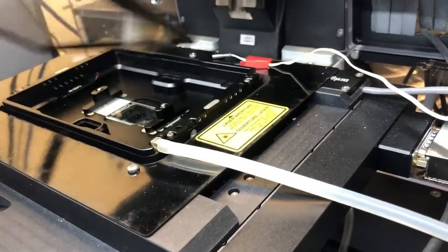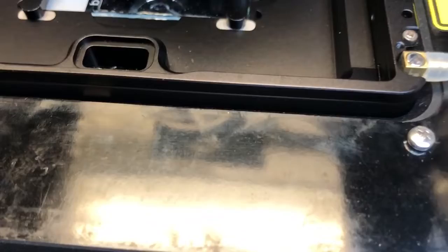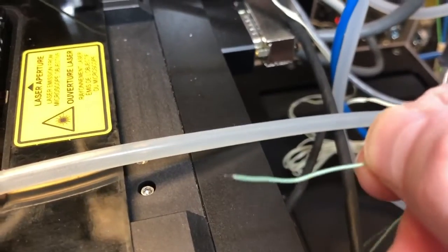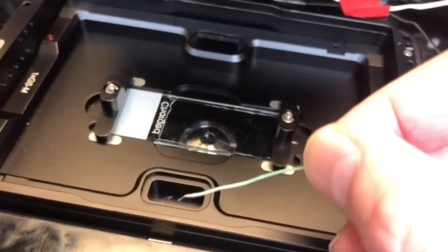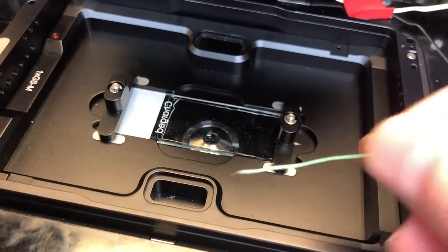For that, we need to remove the lid. What we're going to do is fill this container with water, put a special lid on it, and then thread this thermometer — which is a little wire — in through the holder and into this container with water.